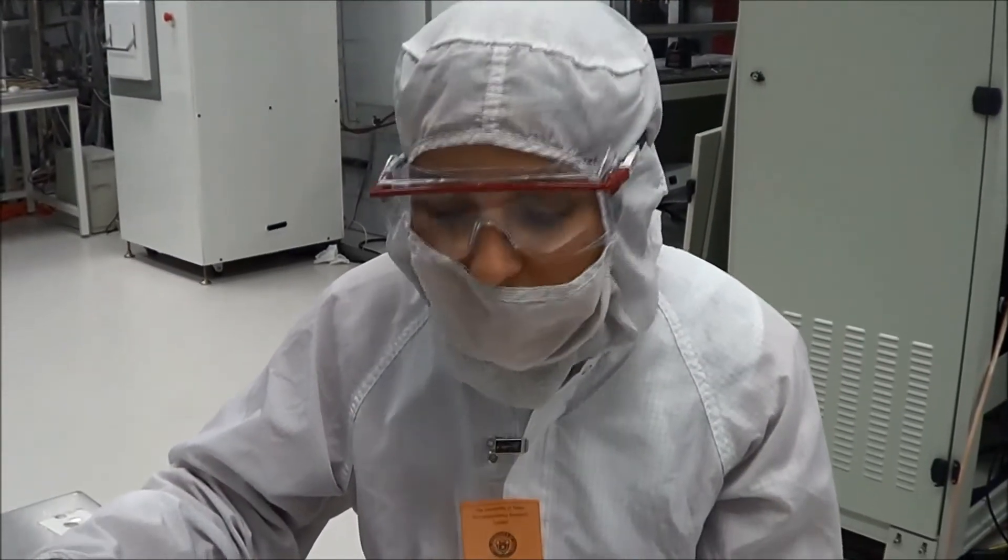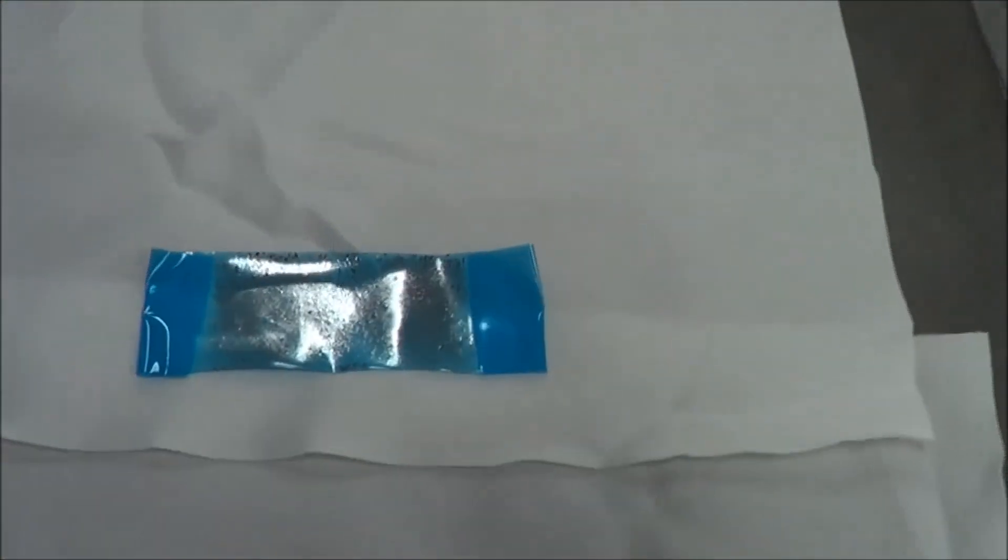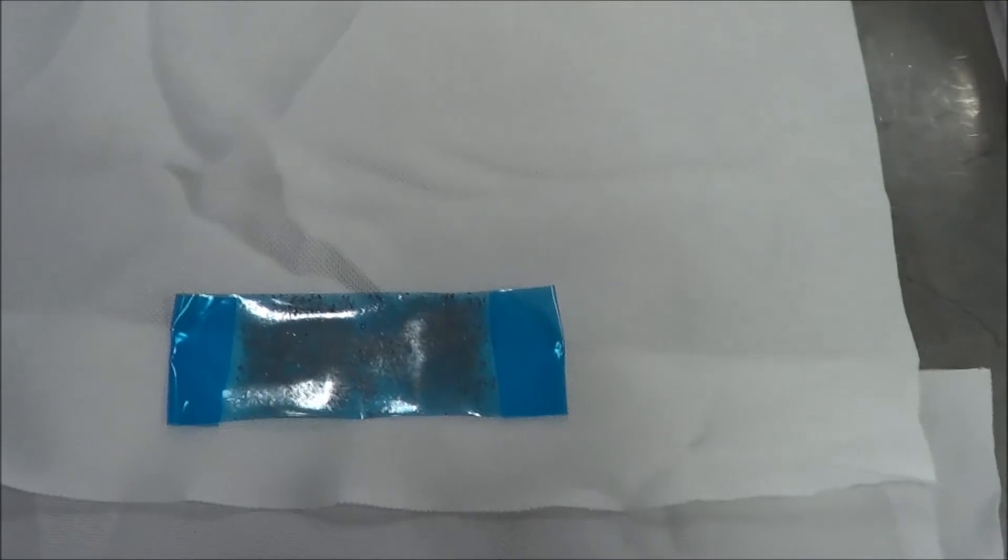Once you have gone under multiple exfoliations, your blue tape will look something like this. The entire area of the blue tape will be covered in flakes of your TMD.